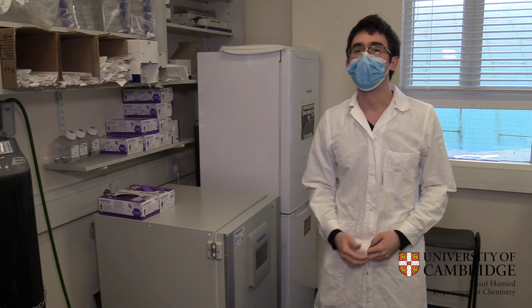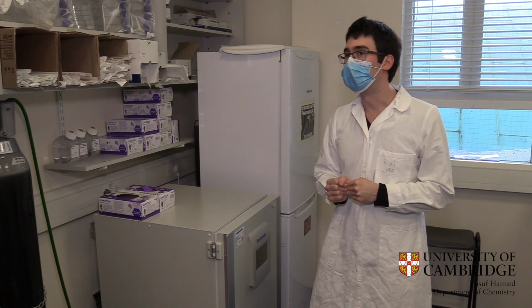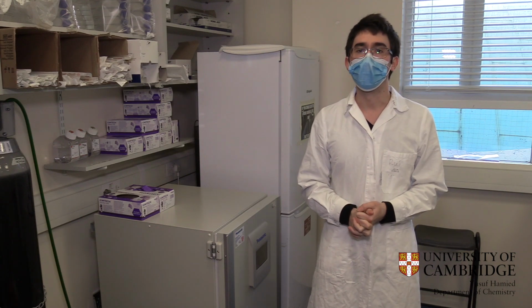Okay, so at the moment we are in our lab, and this is a containment level 2 facility designed for working with cell cultures, and I'll show you what facilities we have to offer in this specific lab. Most people in the group are doing some kind of cell work, and this is the incubator where we are growing our cells. We are growing both animal cells and human cells depending on what kind of pathologies we are studying. This is our safety cabinet where we are doing all of our cell culture work, and we actually have very clear protocols in order to prevent contamination in our cell cultures.